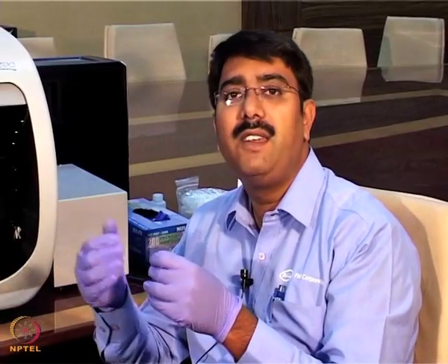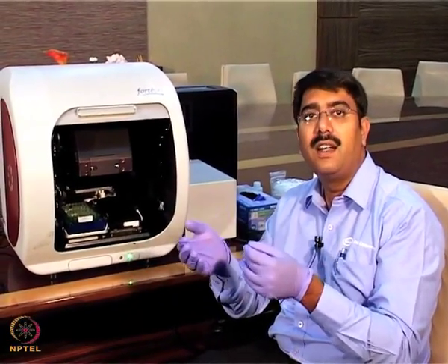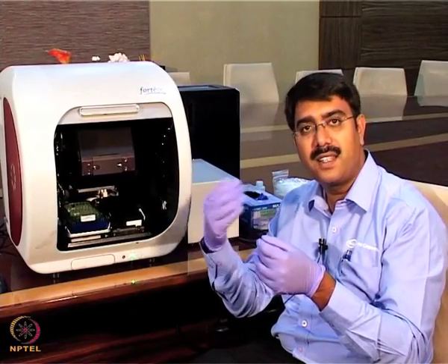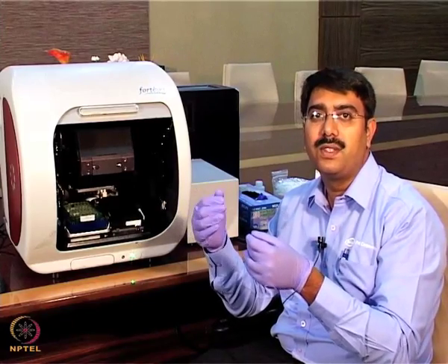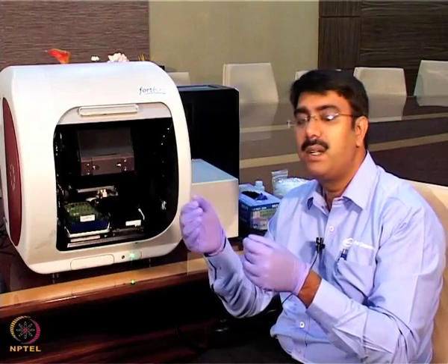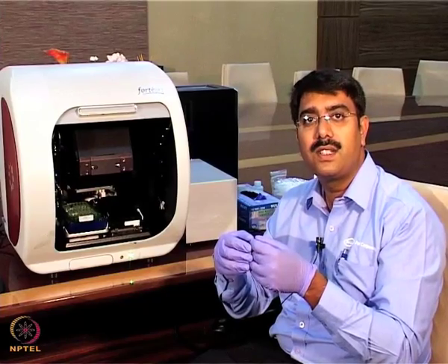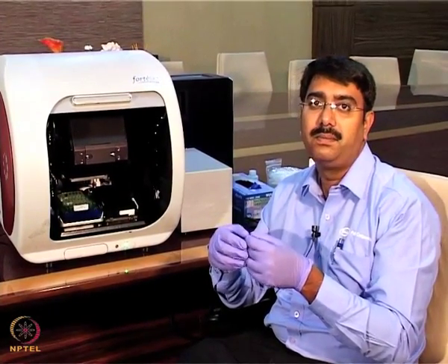This instrument is useful for quantification purposes. Say suppose in the case of industry or any protein, if you want to do a quantification, we can directly take known concentrations of the standards, generate a standard curve, and from that we can determine the unknown concentrations. Apart from that, the major use of this instrument is to study binding kinetics, where we determine the rate constants like on rate and off rate, as well as the affinity constants.